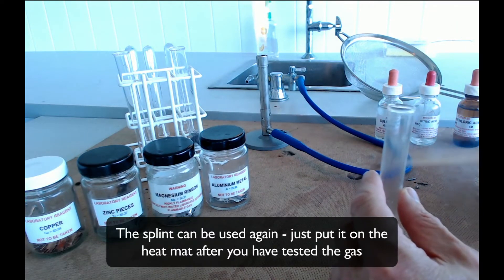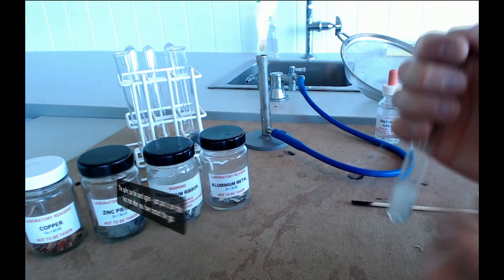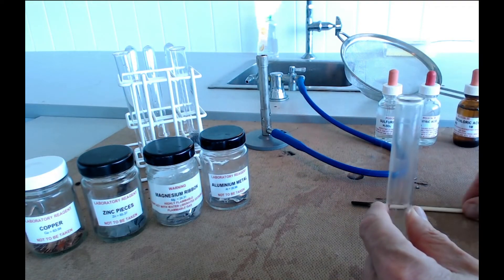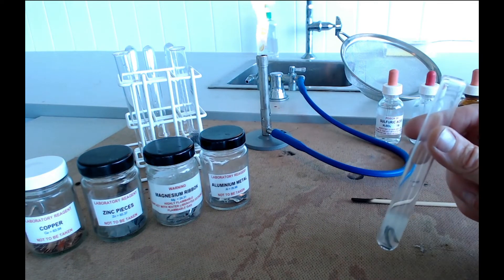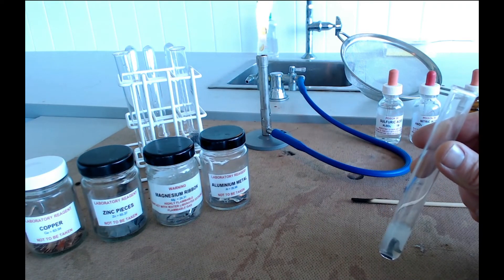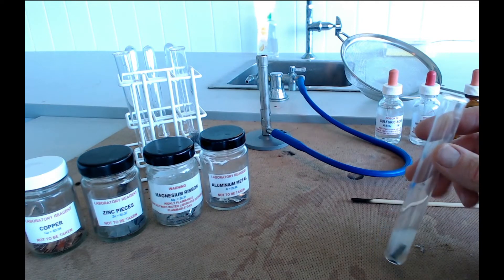Now I have taken my thumb off the test tube quite a long time there before I lit the gas. And bear in mind if this gas is lighter than air it's just going to escape from your test tube while you're in between tasks there.